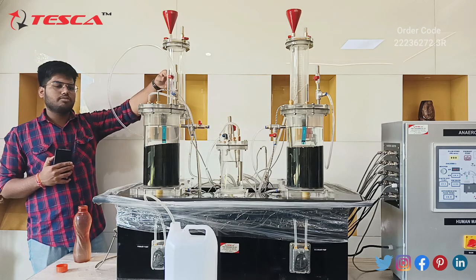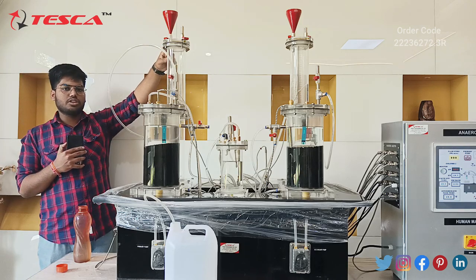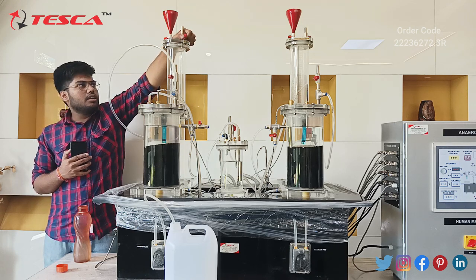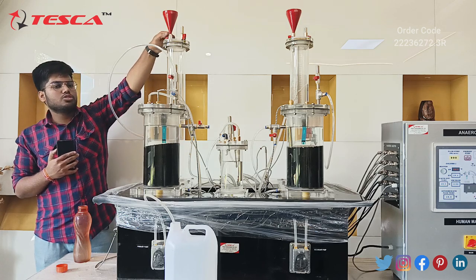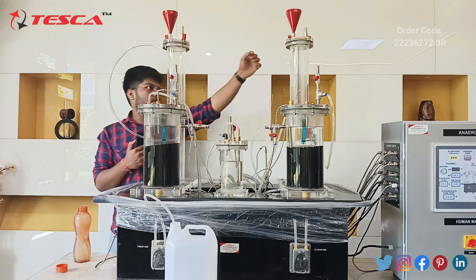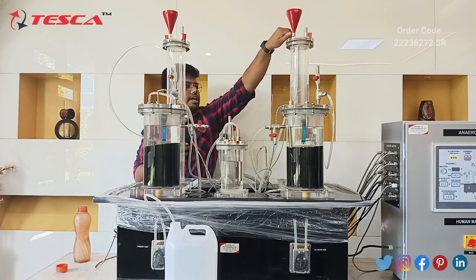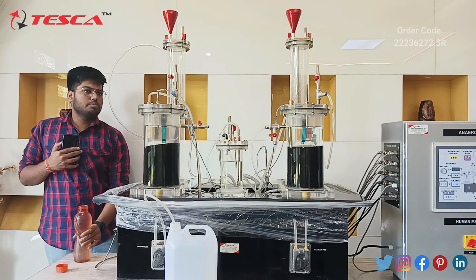Now we will fill our gas tank 1 and gas tank 2 with water. While filling, make sure that the air valve is open for air to pass into the tank and the top valve is open so that we can put water into the column. Similarly, we will open both valves in gas tank 2 so that air can pass while we fill water in both tanks.